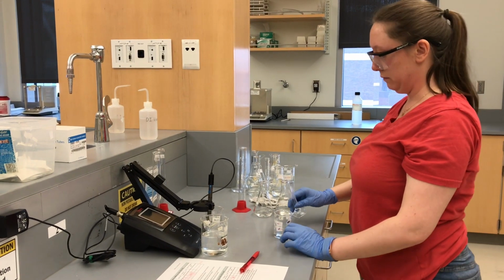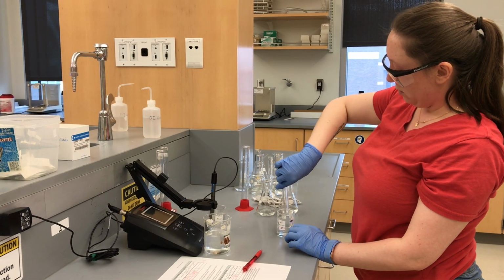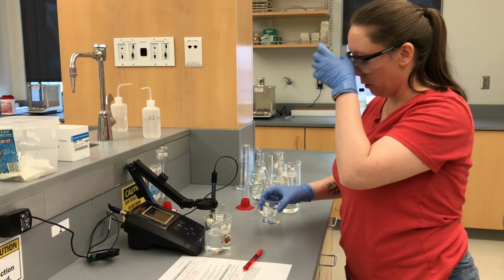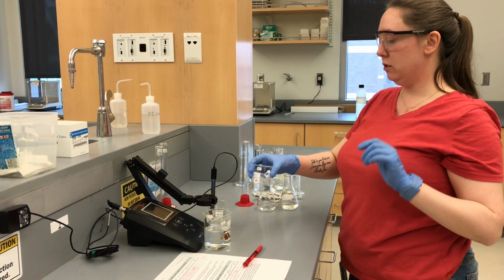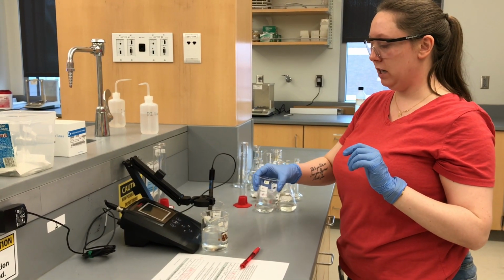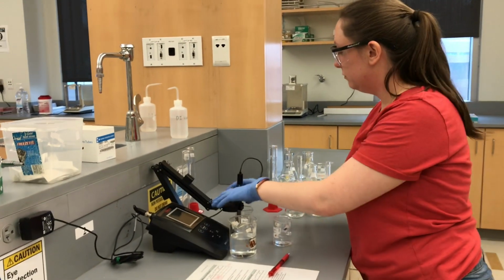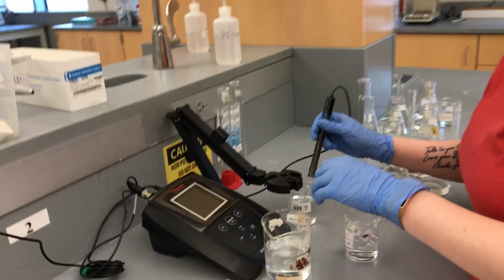Nice. All right. So G, our most dilute solution, and NaOH. Let's see what we got.